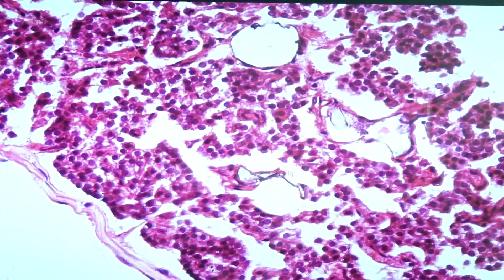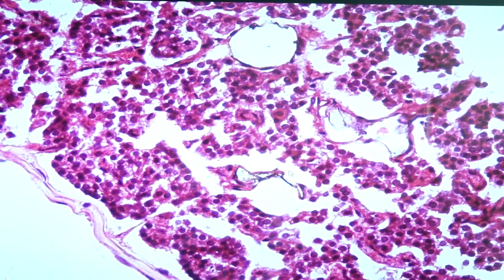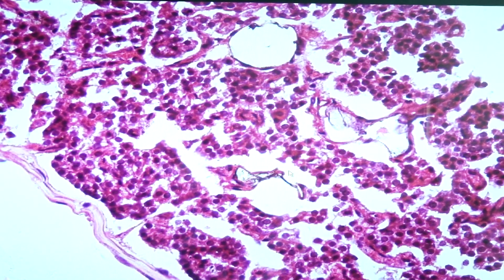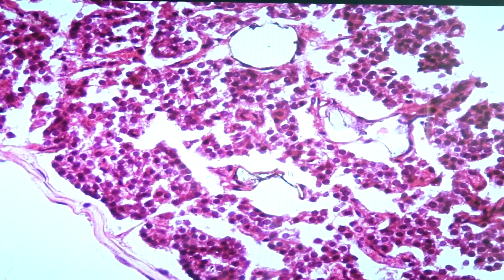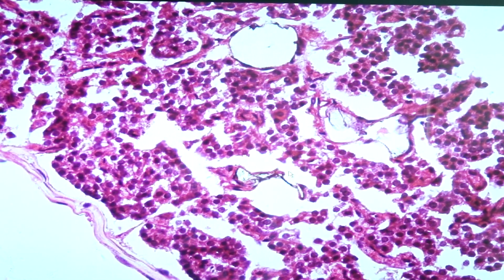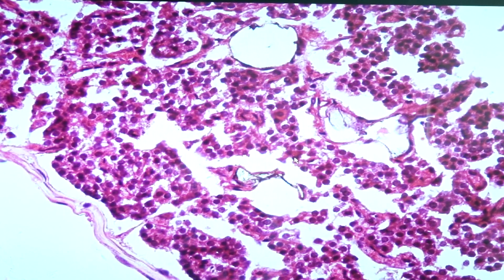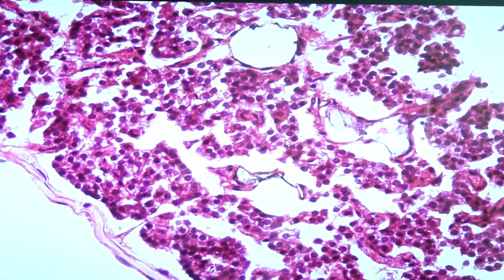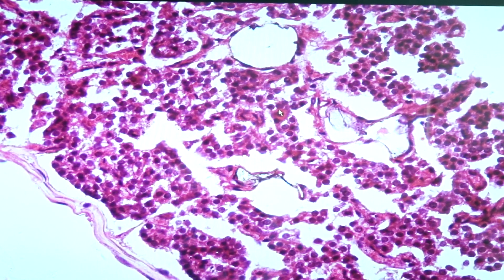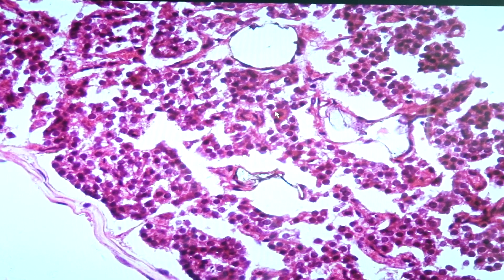The other cell type is what we call the oxyphil cell. They are a little bit larger than the chief cells or principal cells, and they are identified by their acidophilic or red cytoplasm. So this would be the oxyphil cell.